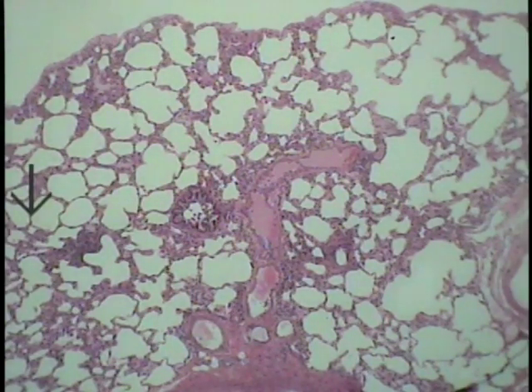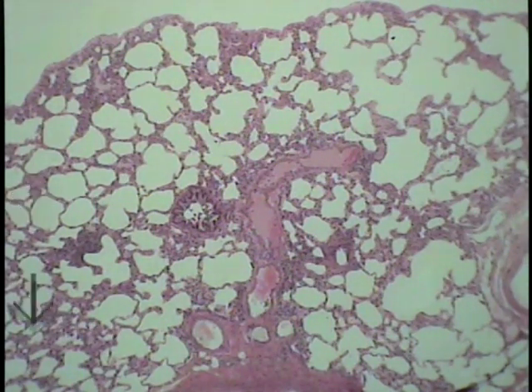Having completed an examination of the materials available for the extrapulmonary conducting portion, we turn to examining a section of lung, concentrating initially on the conducting portion. What you see in the field of view is a section of lung, with alveoli making up the background.